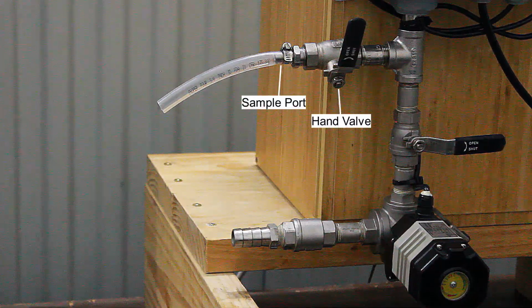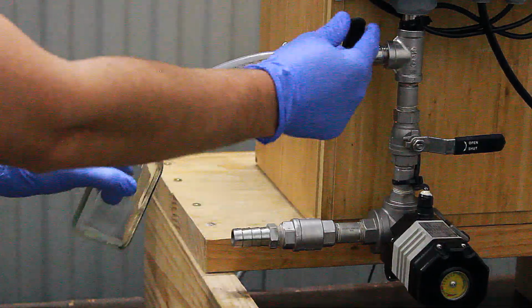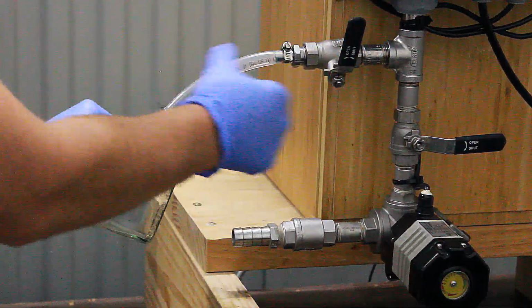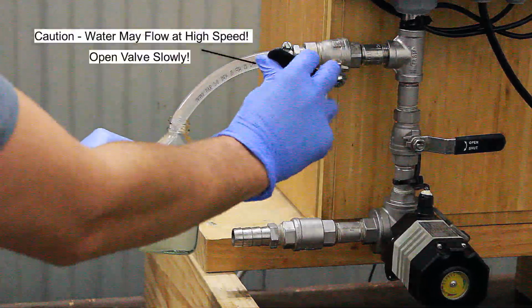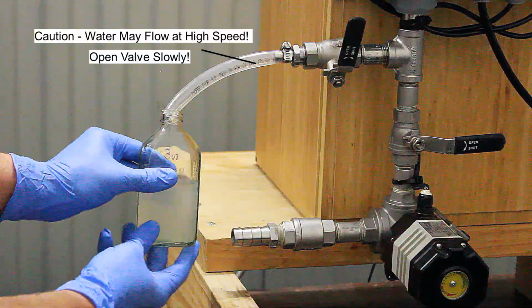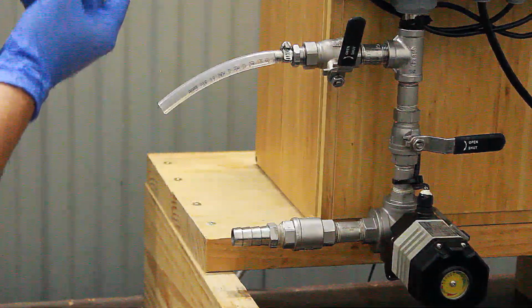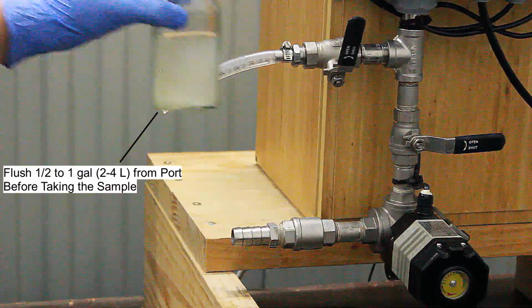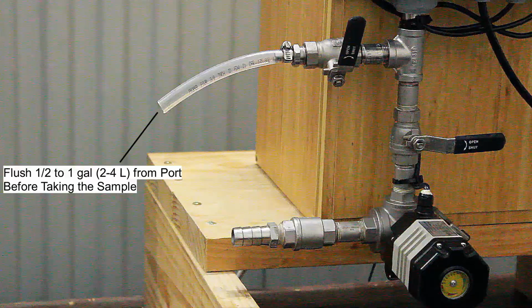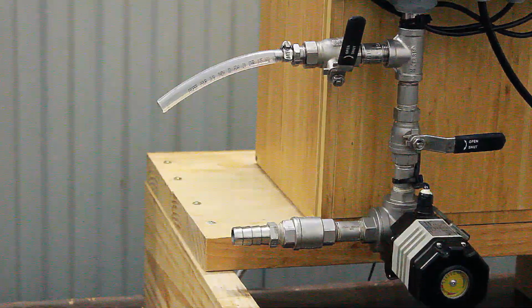Here is the standard 3/8 inch sample port and tubing on all current OilWatcher models. The hand valve can be opened to grab a sample of process water. Please be cautious and open the valve slowly, as high pressure can cause rapid flow from the port. Also, before taking the sample, 1/2 to 1 gallon of water should be discharged from the port in order to clear out any oil or solids that have been deposited within it.